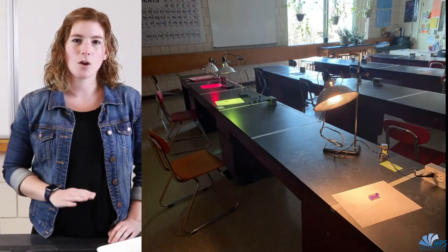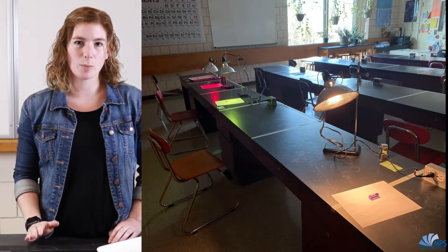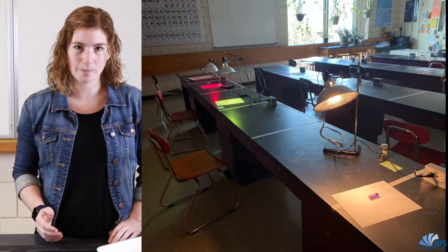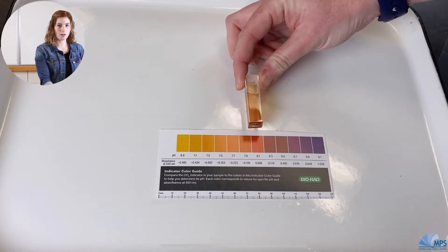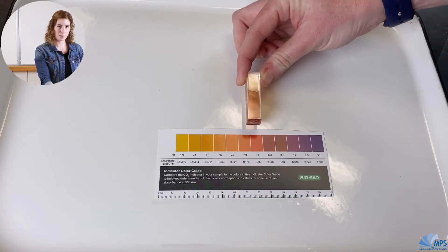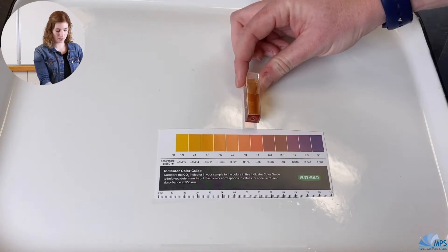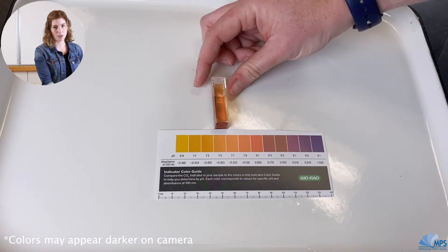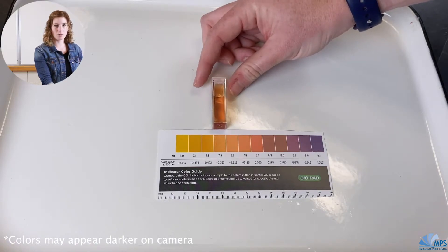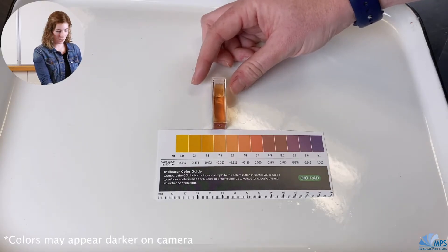To start, we want to look at what the carbon dioxide indicator looked like with no algae beads in it — this will be our control. My carbon dioxide indicator is in this cuvette right here, and I'm going to match it up to this pH scale. This plain carbon dioxide indicator color matches best with a pH level of 7.5, just sitting in the cuvette under no conditions.